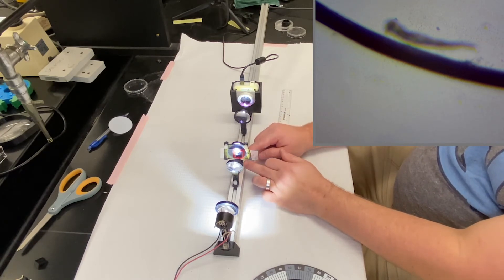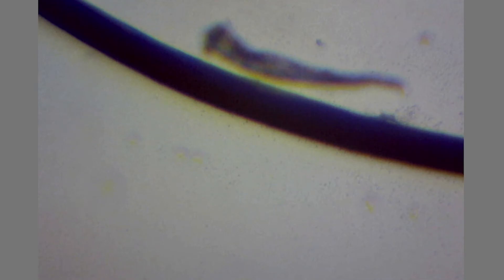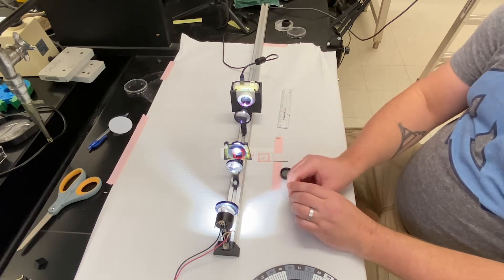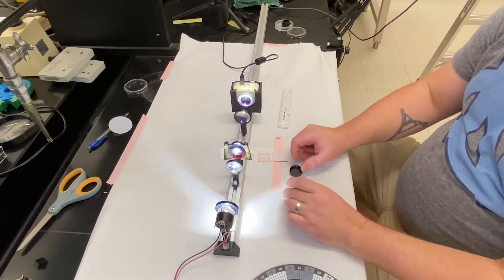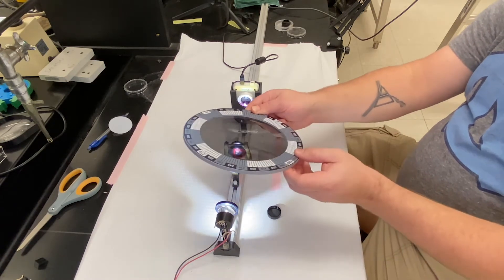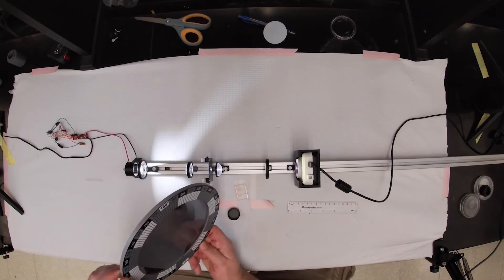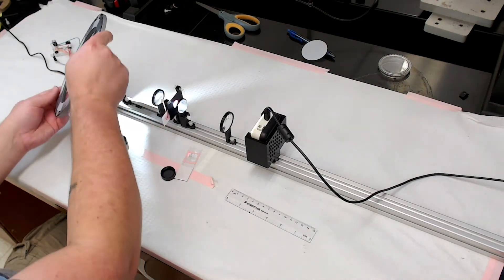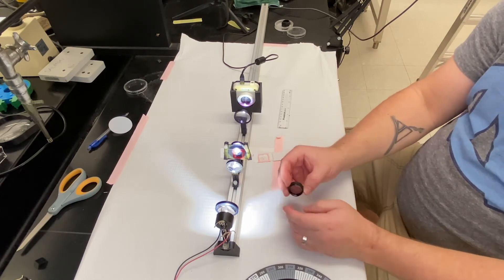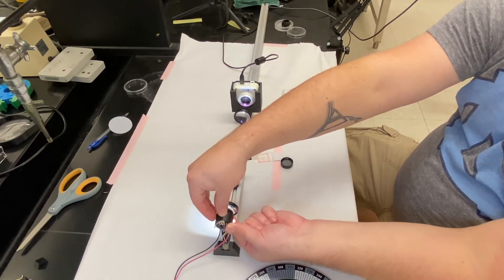There's a good hair. It's quite dark because of all the pigment in it — really take note of the negative contrast that provides. Step one of building our polarized light microscope is installing one of these polarizers right in front of the LED so that the light coming out is polarized. But first, let's double-check that the LED light is not already polarized. Looking through the polarizer, I'm not seeing significant dimming or brightening from any direction, which confirms the LED is non-polarized — good, because now we can easily control polarization by installing a linear polarizing filter.